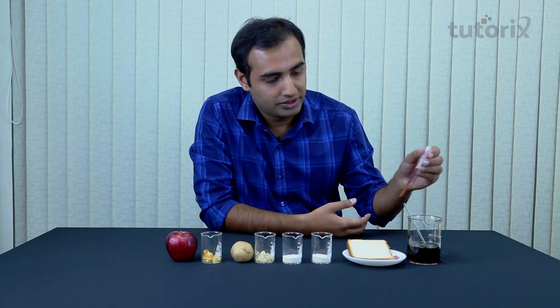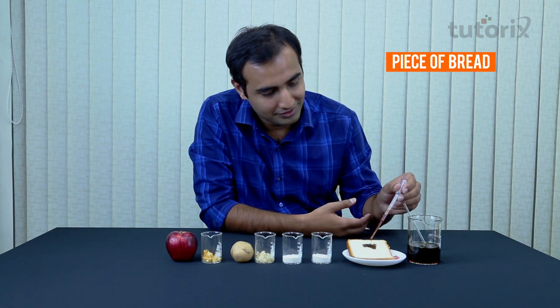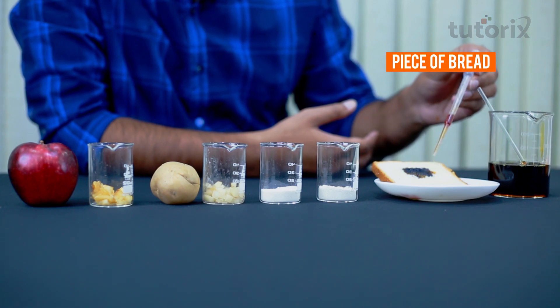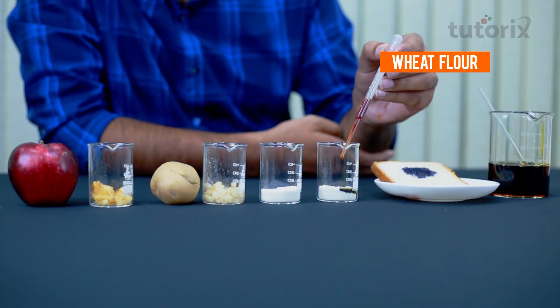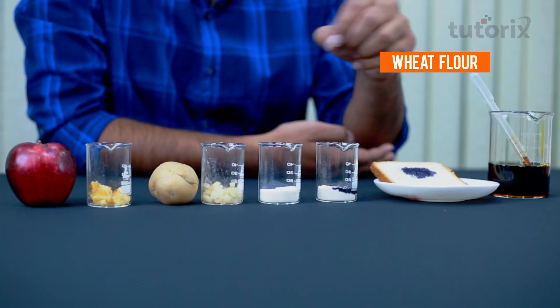I put the iodine on the bread. Can you see the yellow color of the iodine solution turning violet or blue-black instantly? This shows that bread contains abundant amounts of starch. Now let's try it with the wheat flour. I pour the iodine solution on the wheat flour, and if you give it a moment, you will observe that the yellow color of iodine once again changes to blue-black. So we can say that wheat also contains a lot of starch.